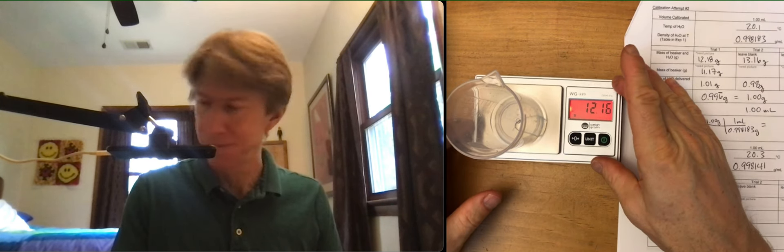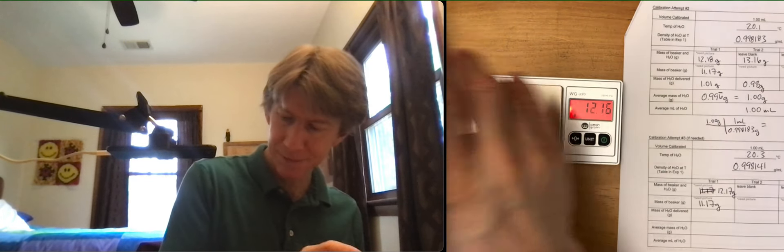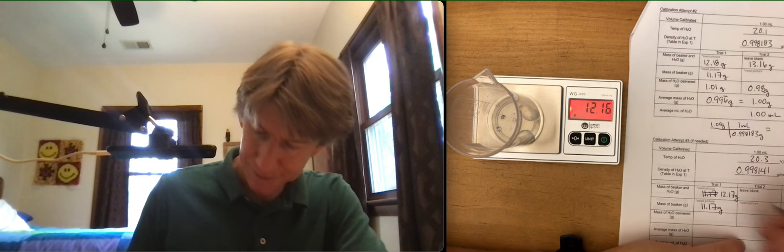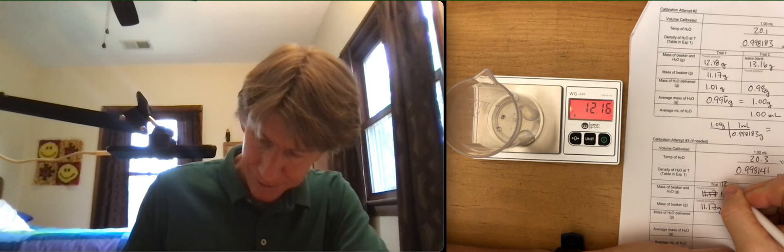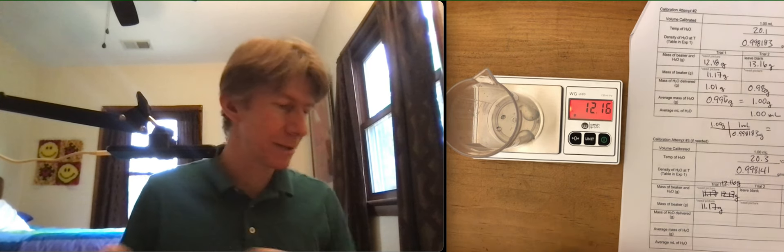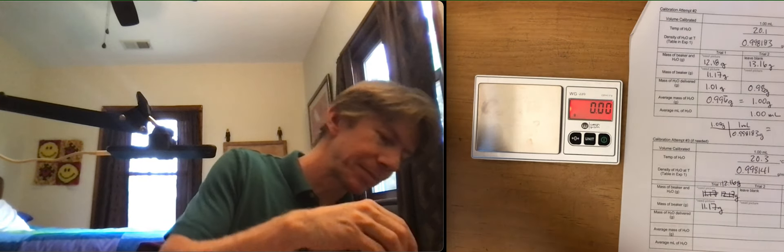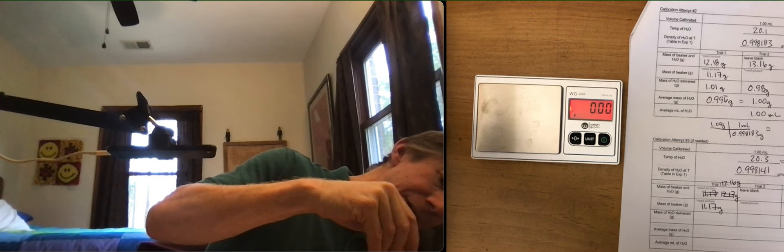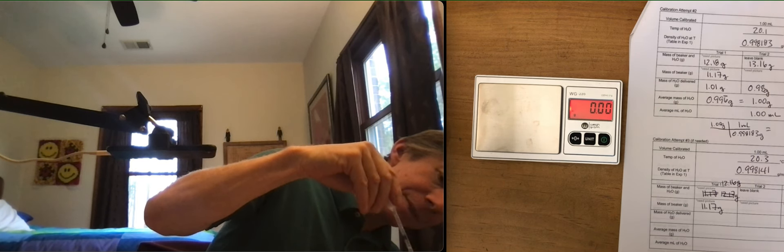Oh, wait a minute. Went down to 12.16. Got to go with your data. Take it off. Air bubble. Come on.